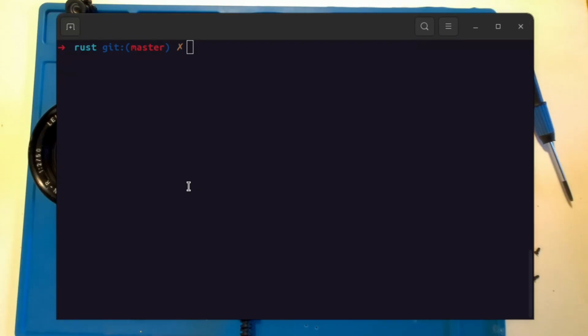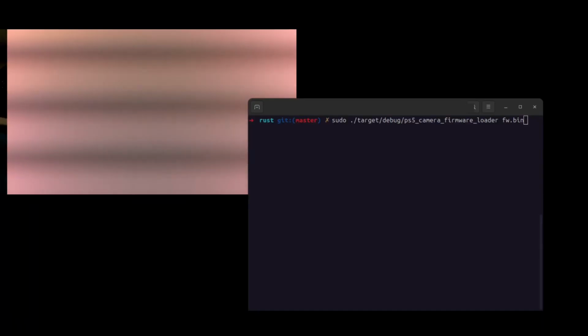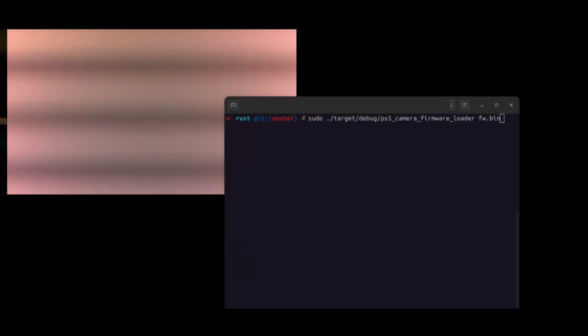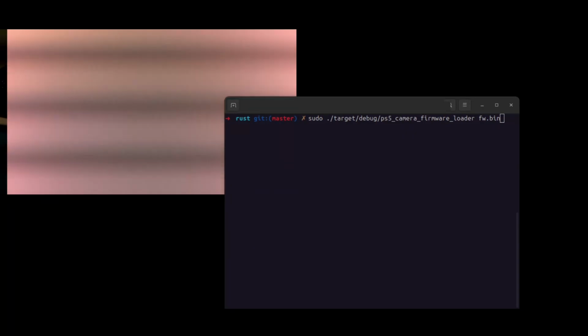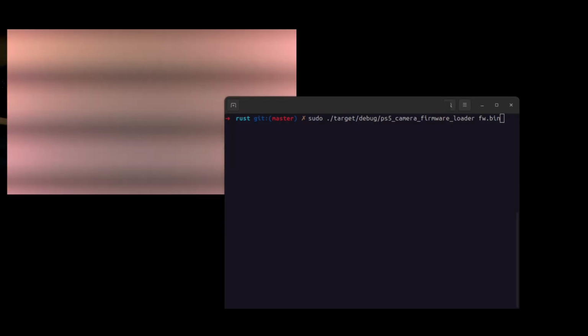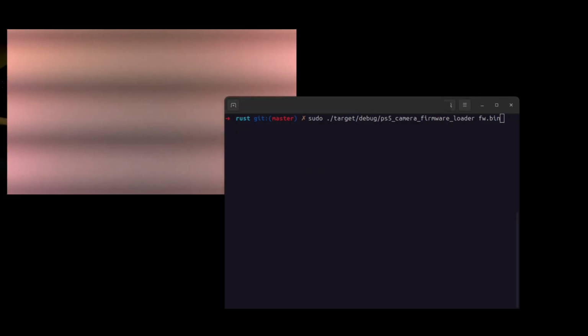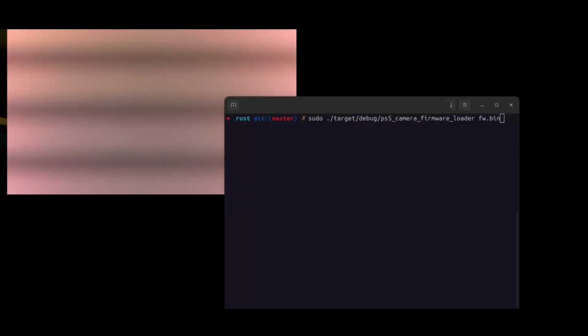So right now the camera doesn't actually know that it is a camera. We have to, like an actual PS5, flash the software onto it, and someone already made a handy script for that, which I will link in the video's description. Once you have the script compiled and have the firmware file ready, you can just run the command and a new USB device should show up. You can already see the image from the bare chip in the background.